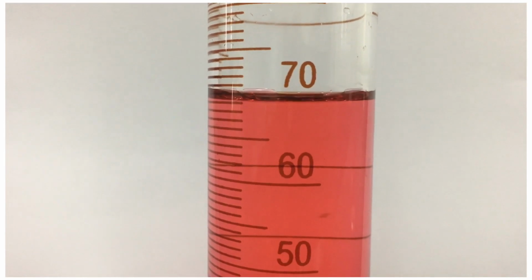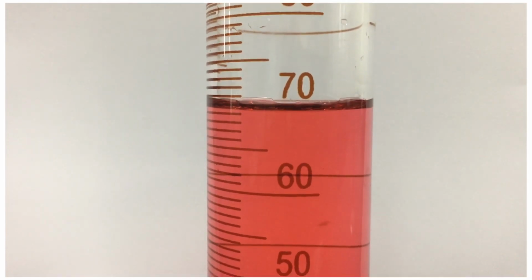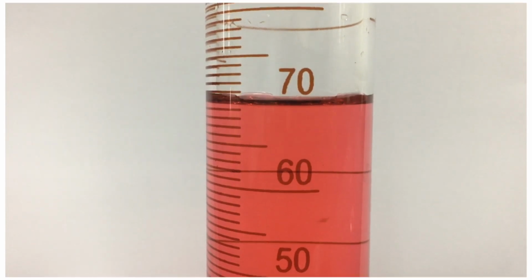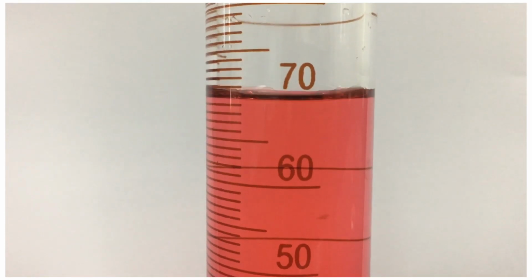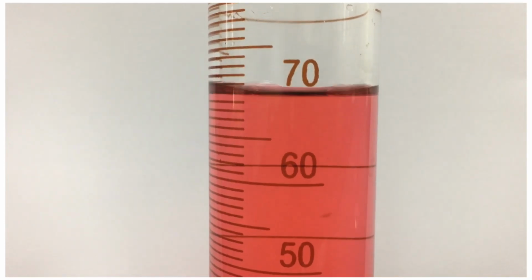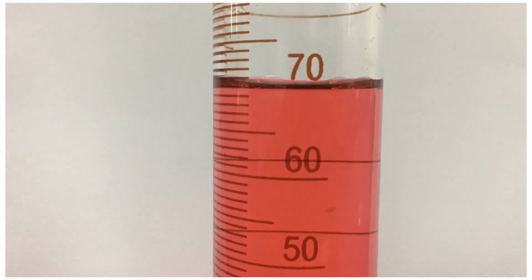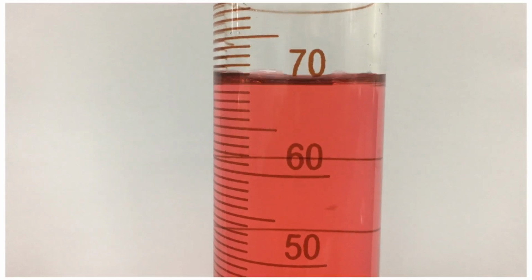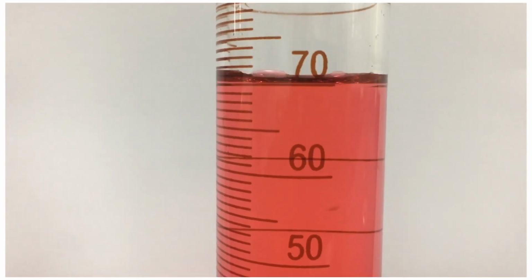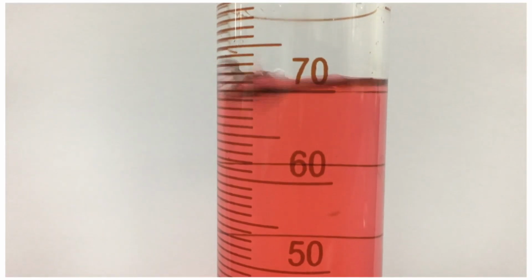In a measuring cylinder, the volume changes from one graduation to another in order of 1 milliliter, which makes it relatively accurate. But a few drops of liquid might be added without changing the level. From another point of view, a slight error might take place when the level of liquid is between two graduations, especially when the diameter is larger.